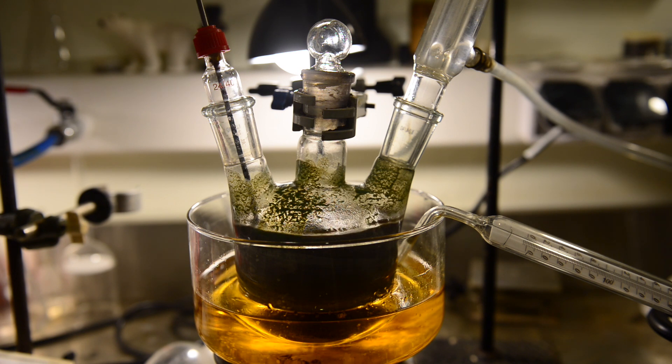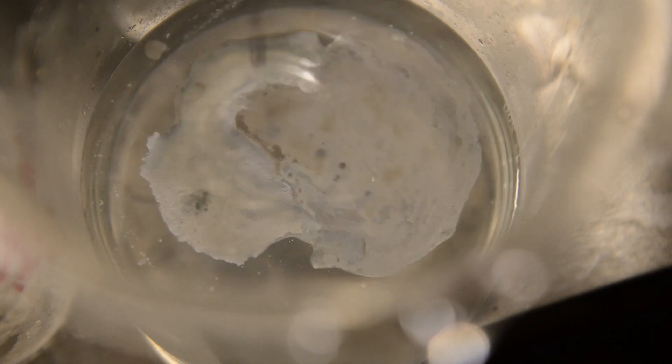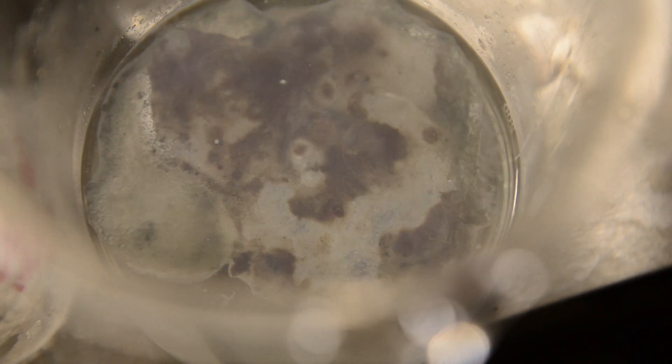Now I need to cool the reaction flask down and decompose the formed complex with water to recover our desired product. The patent calls for a kilogram of ice but as I have noticed complex decomposition is not that exothermic so I have just used one liter cold distilled water. You can see how the complex behaves when it gets in contact with the water surface.